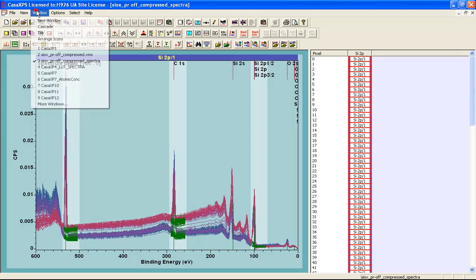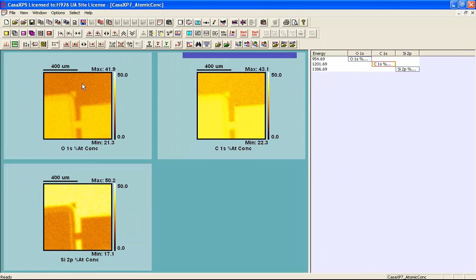So when we extract information as atomic concentration, we get three images. And these demonstrate that we have differences in the composition of this material as a function of position. So this is a heterogeneous sample. It's homogeneous within parts of this image. So if we were to choose this patch here, you can see that this has a common theme through each one of these images. So that could be considered a homogeneous material. And similarly, if we were to analyze up here, we might see a different spectrum from a different homogeneous material.